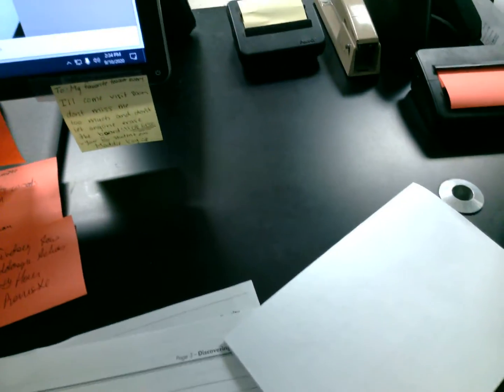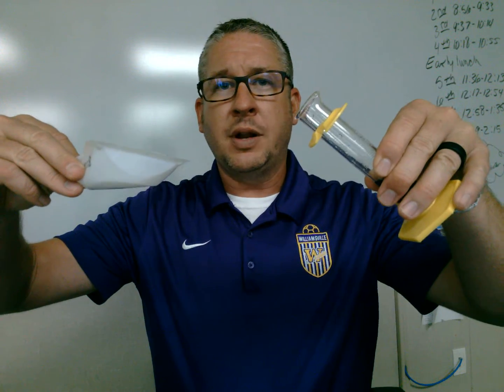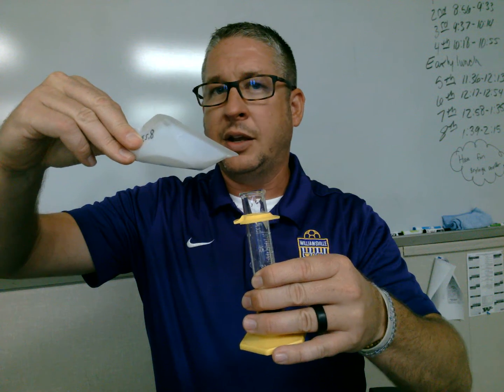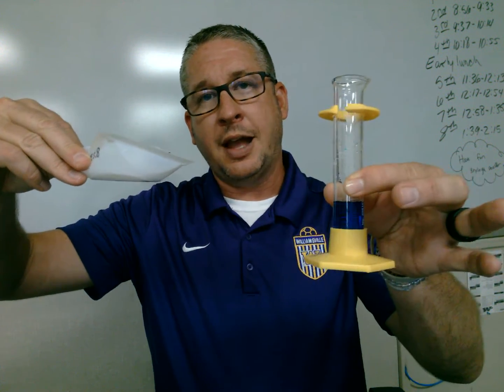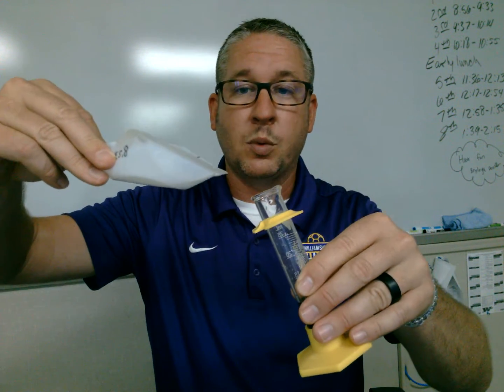All right, now what I'm going to do is return back to the camera, and I'm going to take my first mass, which is the 8.23 that we put in line number 1, and I'm going to very carefully add that sample to here, making sure that I tilt it, because if I were just to keep it straight and pour these, there's a chance that I could have the graduated cylinder break when the metal hits it, because there's really not that much water. I'm starting off with 10.5 milliliters or cubic centimeters, whatever way you want to call it.